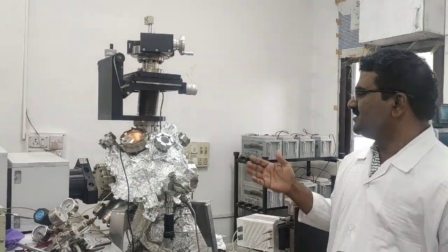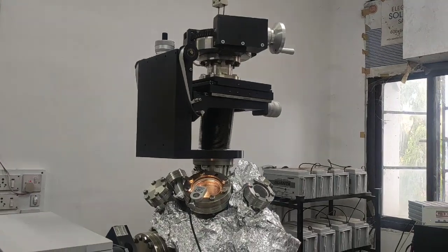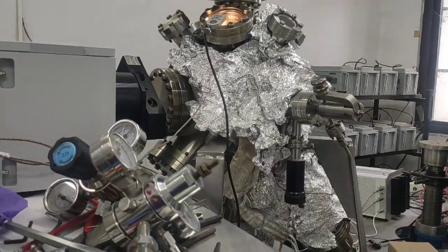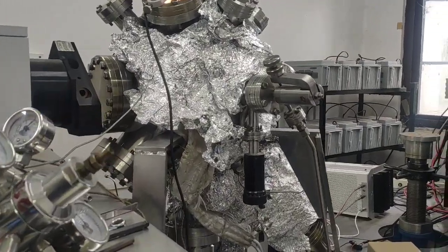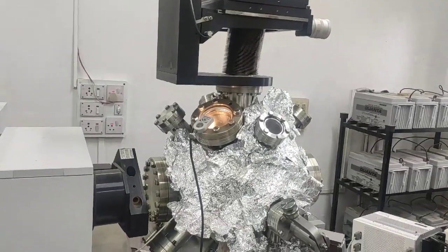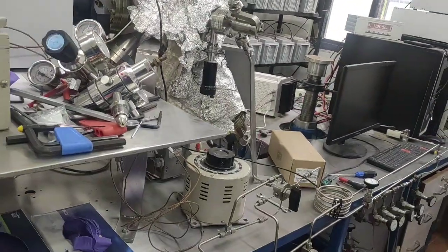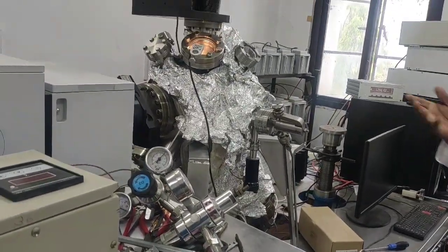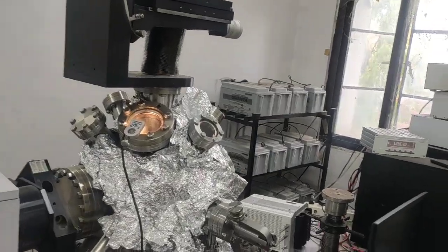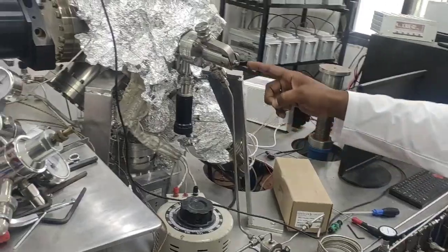the molecular beam instrument. So this is the instrument, the molecular beam instrument. It's again a unique technique in surface science to do reactions on a solid catalyst. And this is the chamber of the molecular beam, and this is the gas mixing line. If you want to do CO oxidation, methane reduction and methane oxidation reactions on some ceria zirconia catalyst or palladium single crystal, then you have to mix the gases in this line, and then this is the source.